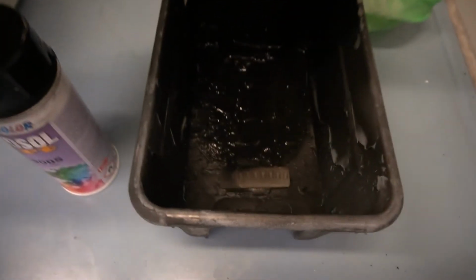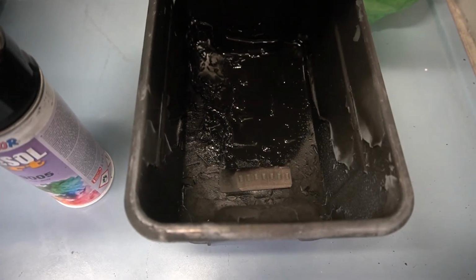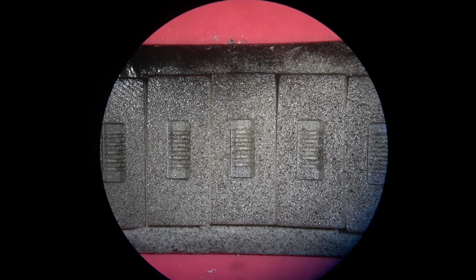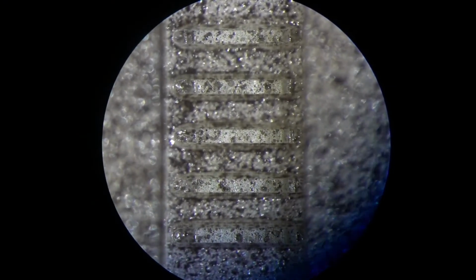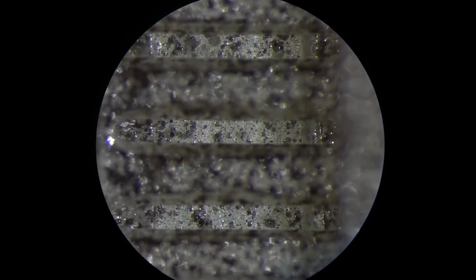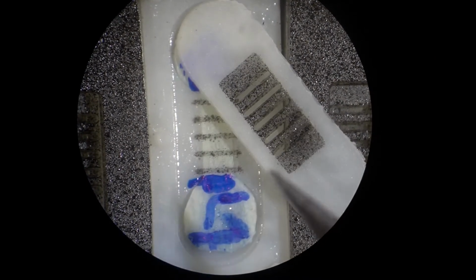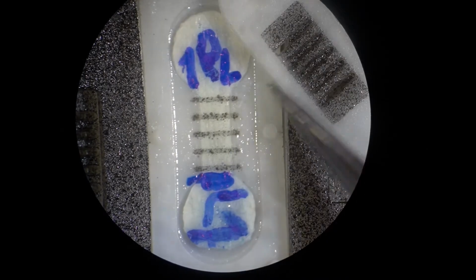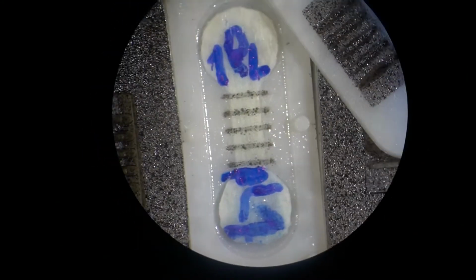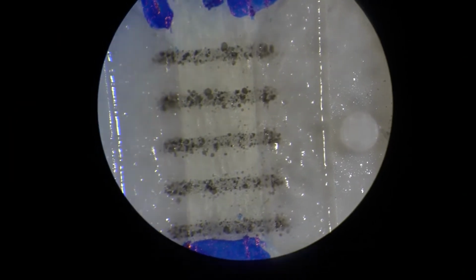We will have a look, and you see that everything is now speckled, and we will take a detailed look in the microscope. Here you can see now our speckled samples, and if we zoom in, you can see that we have now the speckle pattern on the masks and of course directly on the bone. If we remove now the mask, you can see nicely that we have here our applied speckle pattern, and here we can zoom in again, and you see now we have these stripes which are separated 1 mm apart.